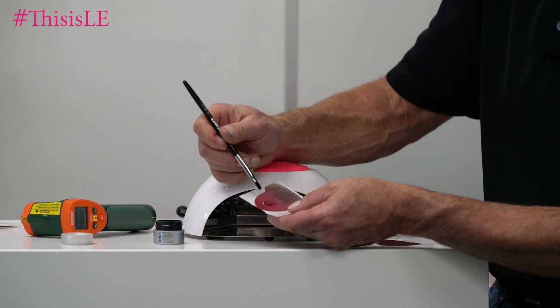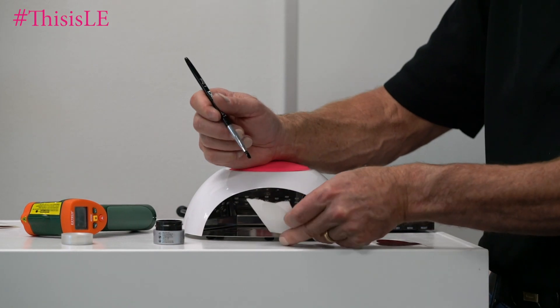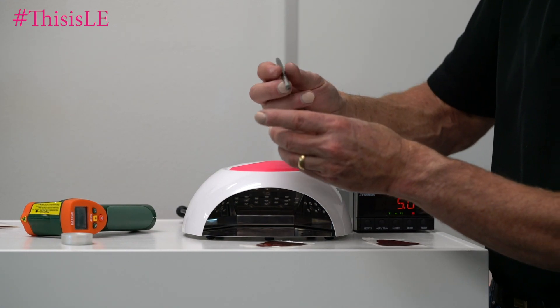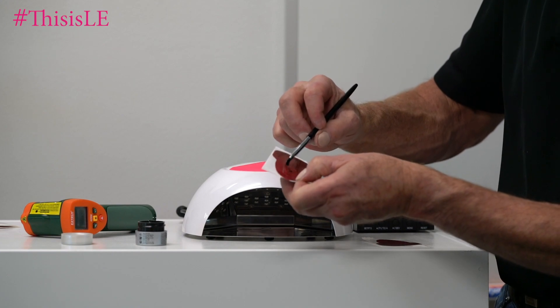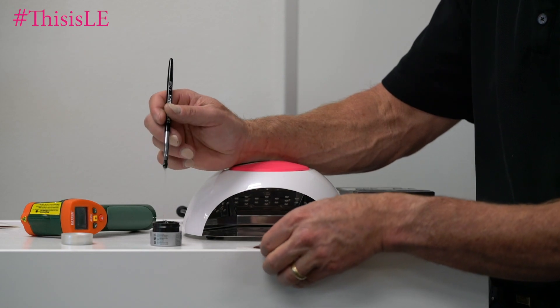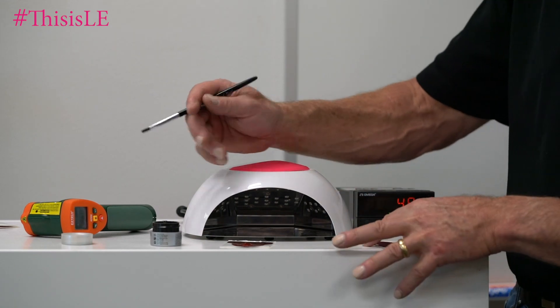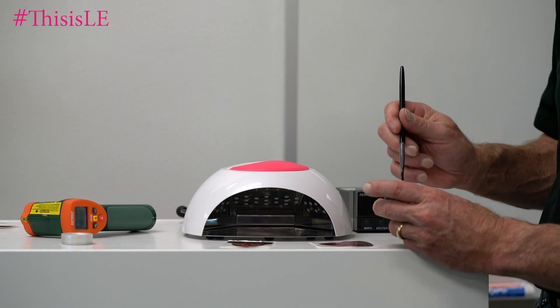So that is not exactly 0.25 grams of gel, but that kind of gives us a little slip layer. I'm going to put a little bit more gel down onto that form, and then I'm going to let that just set for a little bit. While that's setting, I'm going to do the same thing to the other form so it's ready to go when we need it.